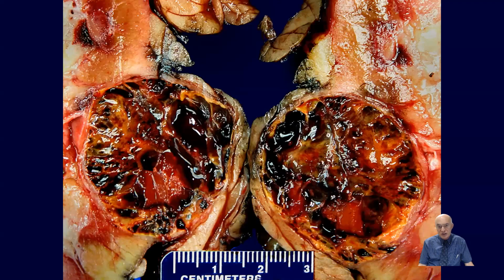Here is another representative section of a typical clear cell carcinoma with this variegated morphology. Even though the tumor is pushing on the fat, you can see that there is a very nice limitation with a fibrotic capsule. Even though it appears to be localized in the area of the pelvis, it's still not involving the pelvis.